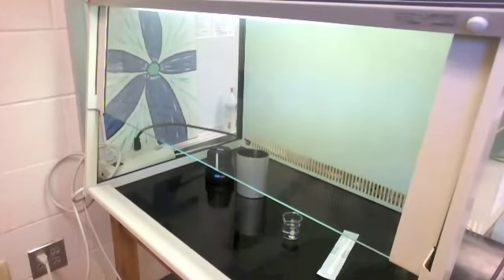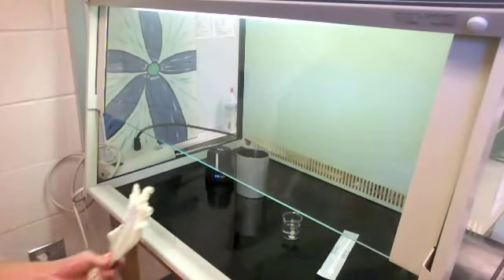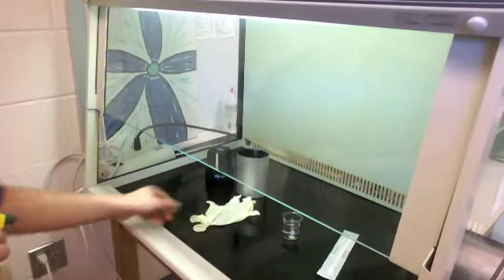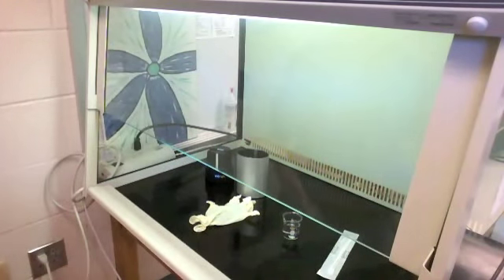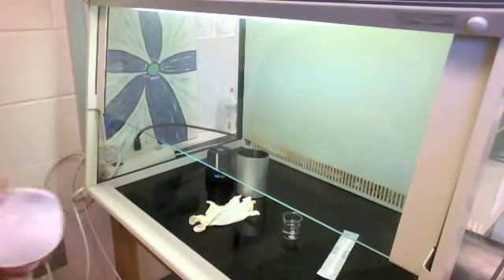In the reflection of the glass you can see me spraying something. It looks like a rubber glove, but my iPod is actually inside that glove. The reason I'm putting it in a rubber glove first is because I need to sterilely transfer my iPod inside the flow hood without the germs from the iPod contaminating things inside.